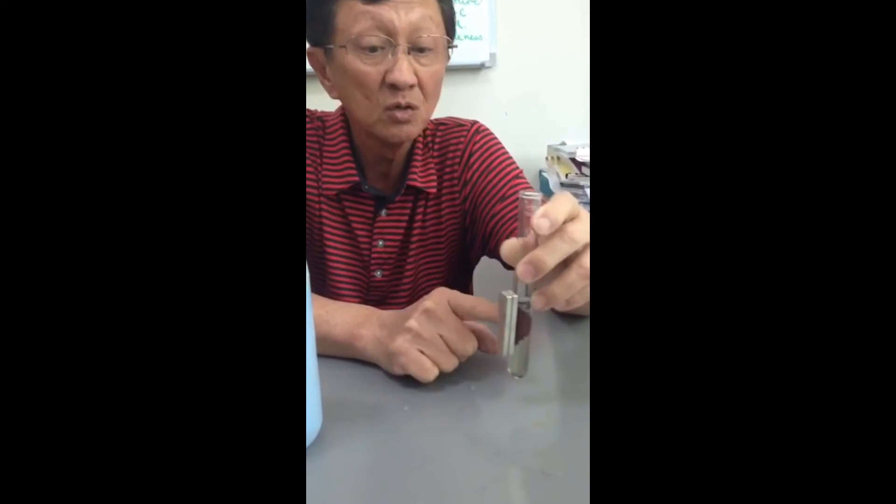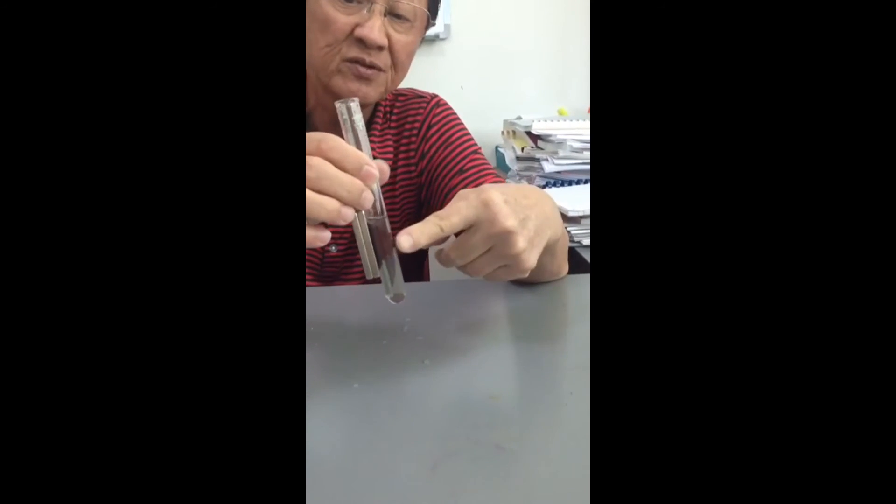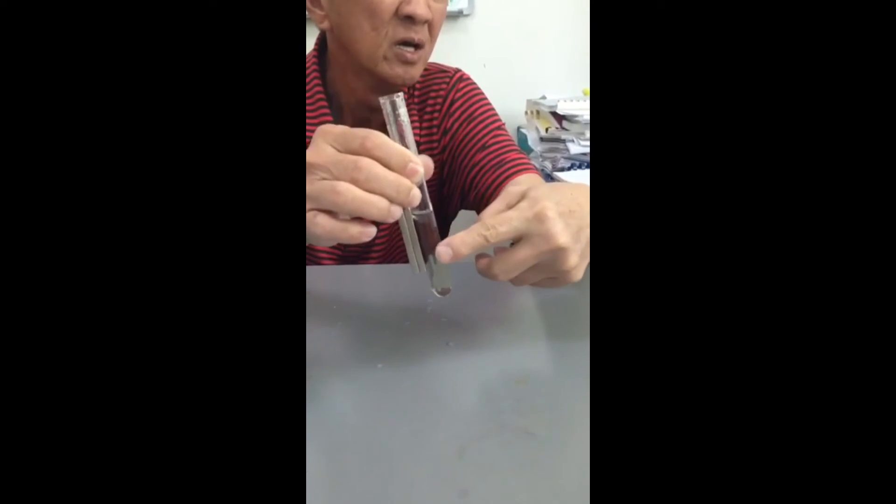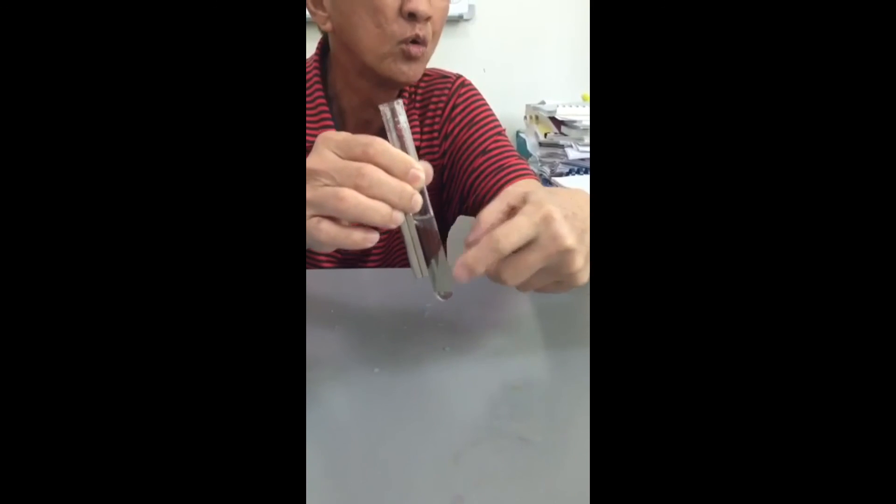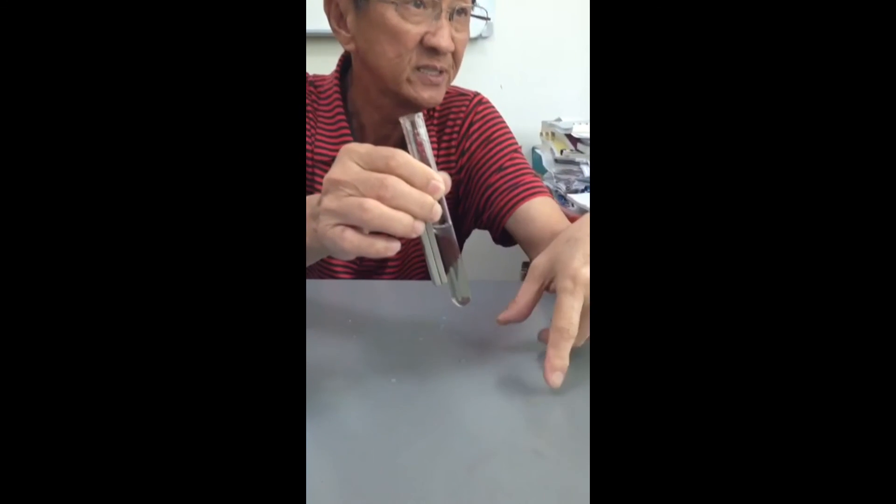Can you see? So although we see that as if this is only copper, but it's actually copper coated over the existing iron.